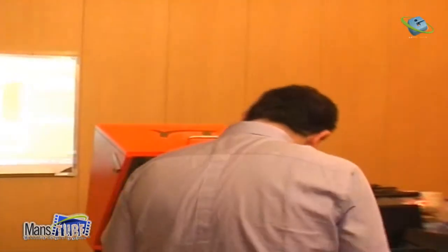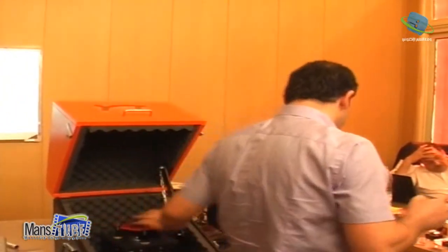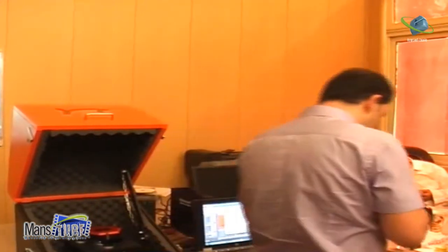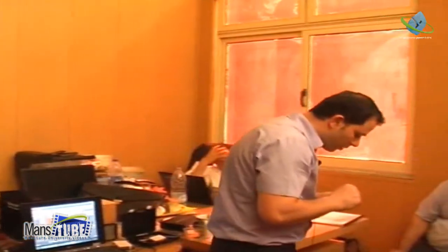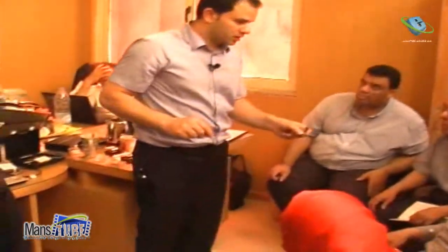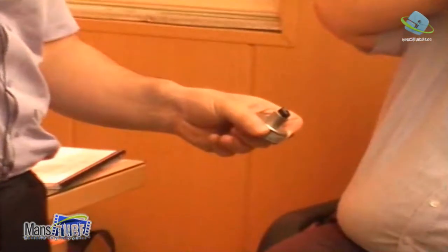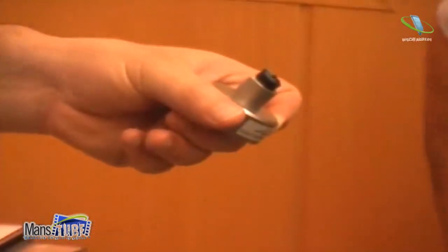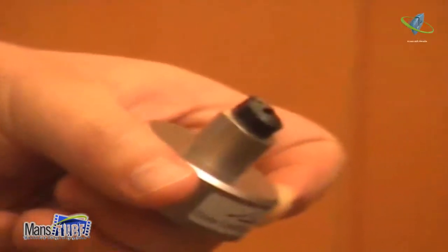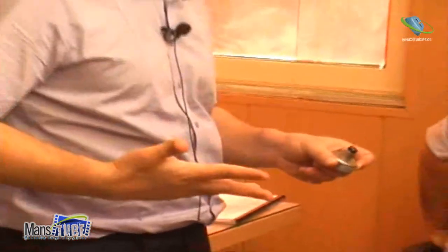If you look again at this cantilever, I don't know if you see it, but there is a small bubble on the cantilever. You see there is a small bubble? Actually, this is the alignment structure. That means when you are in liquid, the laser goes perpendicular, and when it comes perpendicular from air to liquid, it will reflect perpendicular. So when you go to liquid, you don't need to adjust the laser.